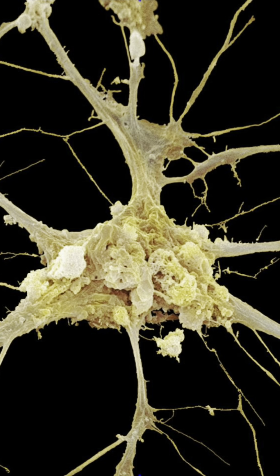Okay, here we have a nerve cell, also called a neuron. You only find this type of cell in the nervous system. And what makes up the nervous system is our brain, the spinal cord, and then peripheral nerves that spread from the spinal column to other parts of our body, like our legs and arms and whatnot.